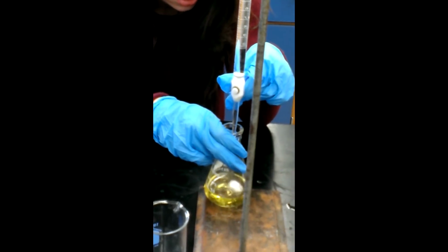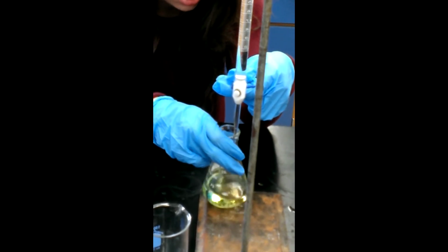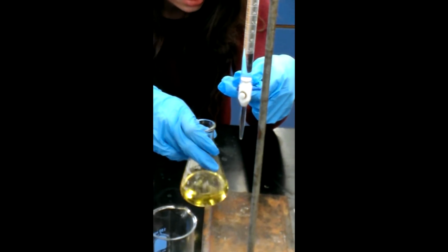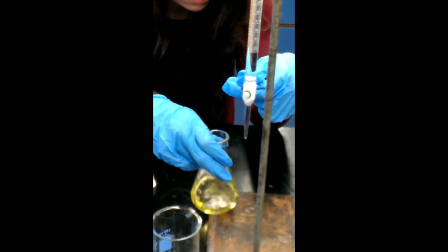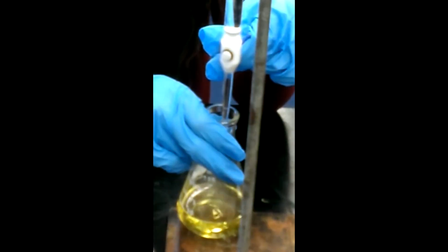This is an example of an individual adding the titrant into the analyte, and as you see, as they add a drop, you'll see a slight tinge of blue color. That means they're getting very close to that titration endpoint. This is of a strong acid, so as soon as they reach that titration endpoint, it's going to very quickly turn blue, and you're going to know that the volume of the titrant is adequate to neutralize the solution.